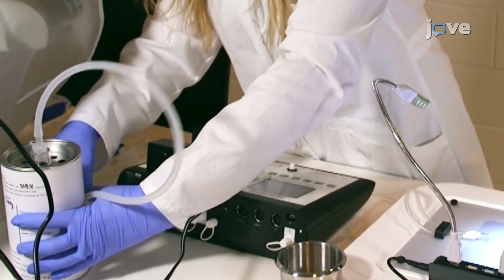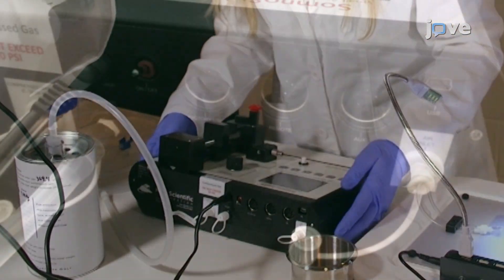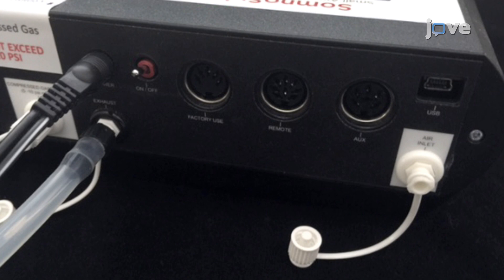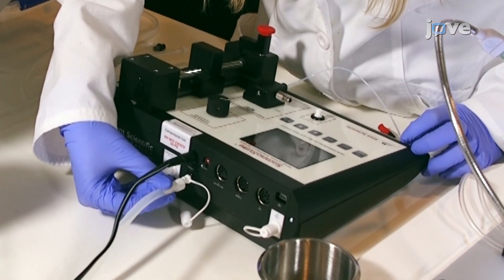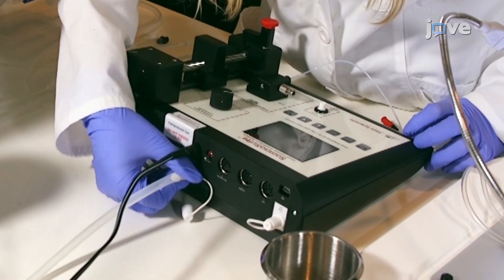First, select a carrier gas source. To utilize the internal air pump, unscrew the rear inlet port, allowing the internal pump to take in room air. Then, connect a charcoal canister to the exhaust port.